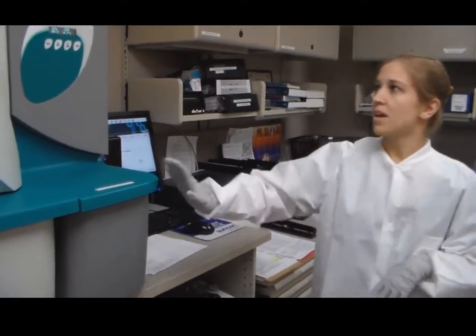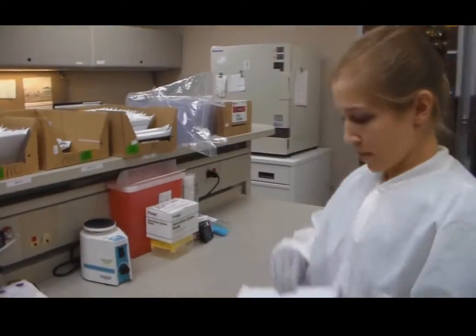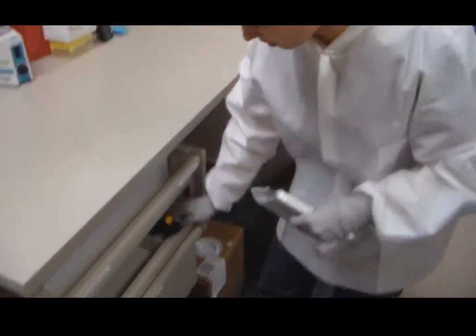We set these up every day. Let me see if I can find an example one. I'll show you what one of these is.